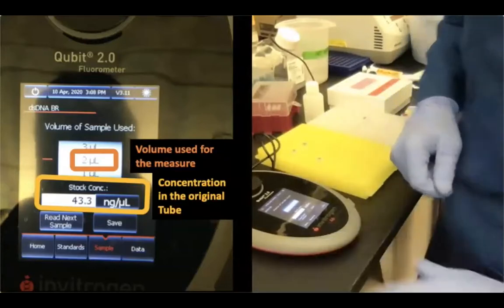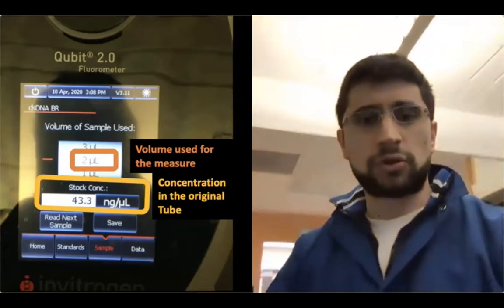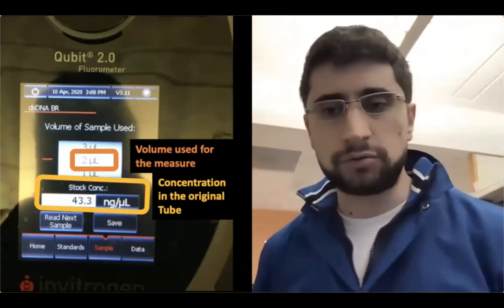You notice that the concentration is different from the TapeStation concentration, more or less in a ratio that I told you you would expect. But we think the Qubit is more accurate, and we've had a lot of experience with the Qubit to submit libraries, and it always works fine. So we usually use the average size from the TapeStation and the Qubit concentration for our final libraries for the calculation of the molarity. And we're going to see the calculation of the molarity in a second.